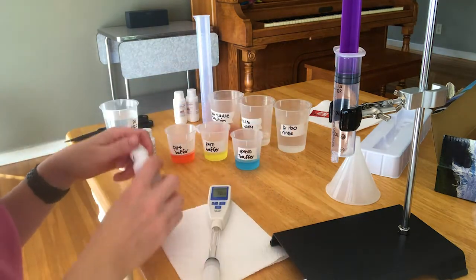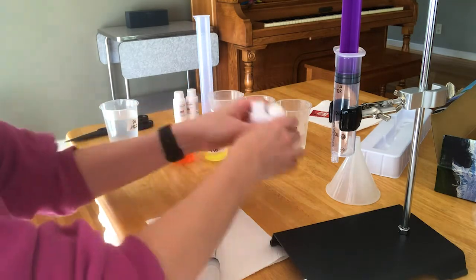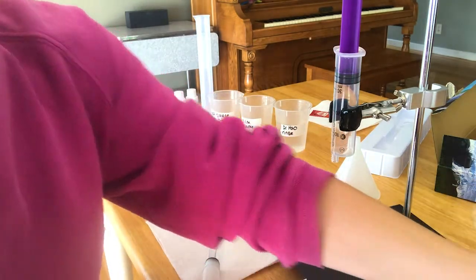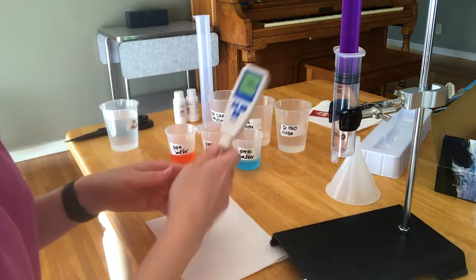Ordinarily, when you're done with these, you wouldn't pour them back into these bottles because you might contaminate it for everyone else. But since these are your bottles, feel free to pour them back in when you're done.